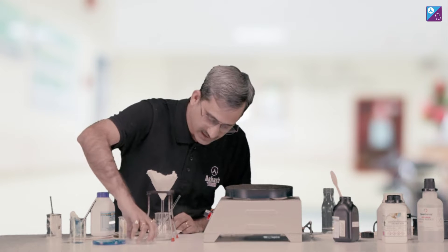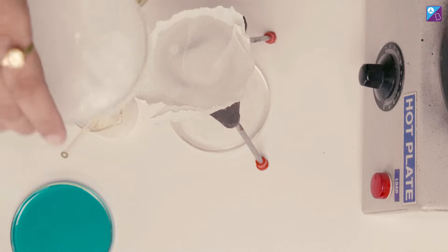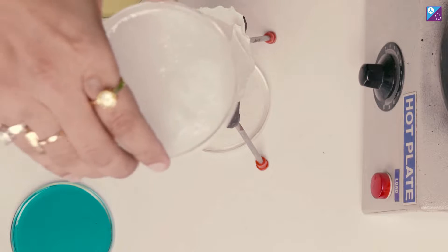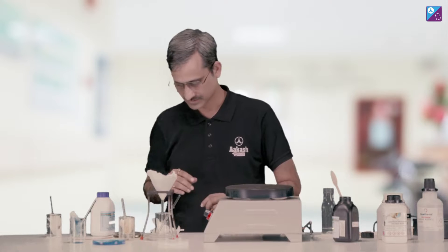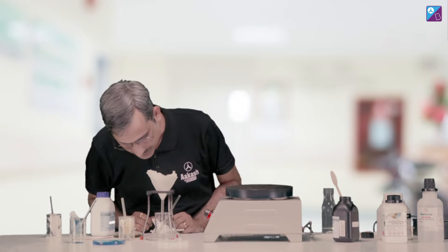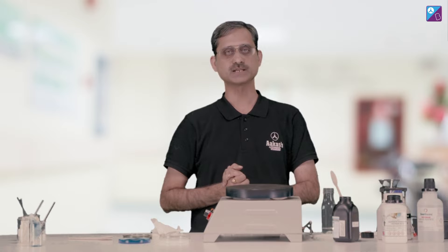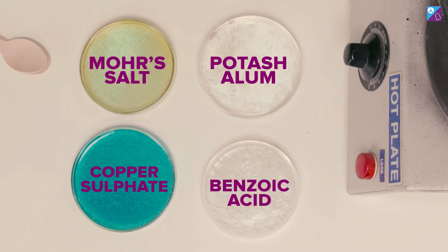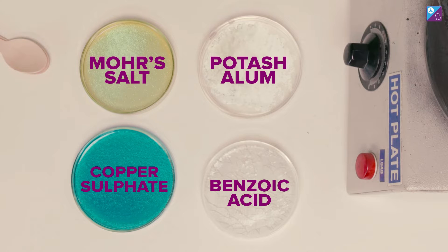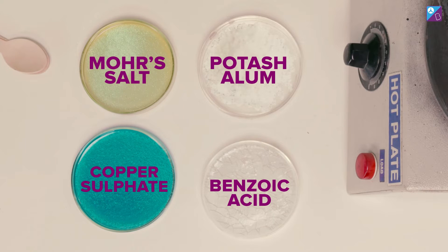As you can very well see, the benzoic acid crystals are already made — the benzoic acid has been crystallized. These benzoic acid crystals are already formed. The crystallization experiment is now complete. You can see the result: the beautiful crystals of copper sulfate, Mohr salt, potash alum, and benzoic acid.